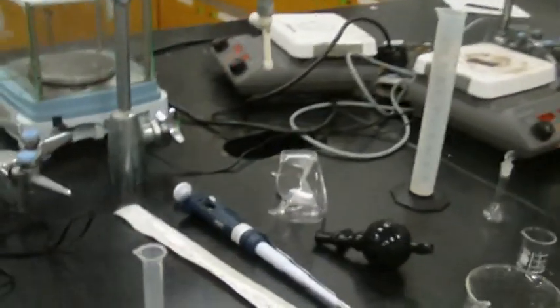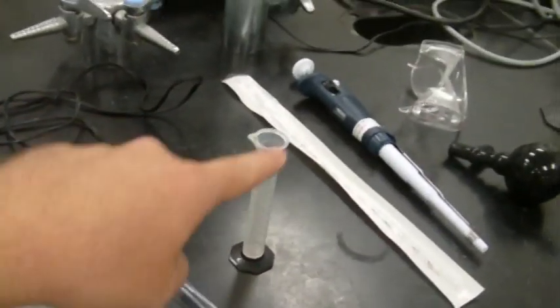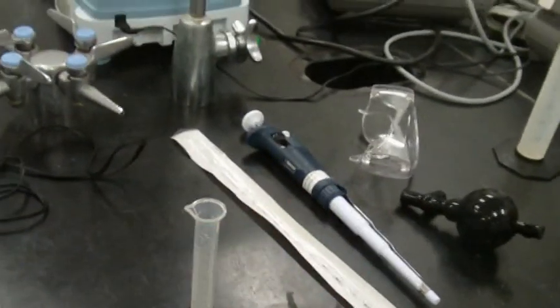Good. Also, I noticed you had a little bit of overlap, which is okay. These 3 for your 4 milliliters, and this one also for your 1 milliliter, right? Right. Which is absolutely okay as well. They don't need to be 3 distinct tools, and they shouldn't be the 3 same tools either to do the 1, the 4, and the 10, because the tools aren't made that way, right? Right. Excellent. Okay, what's next?